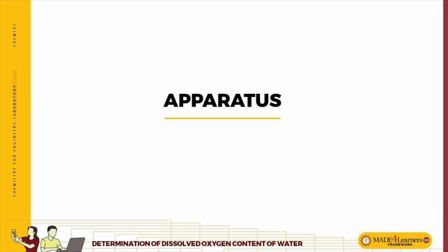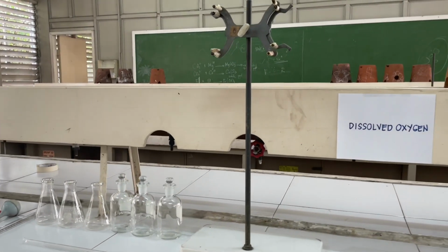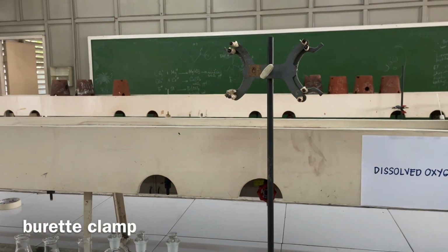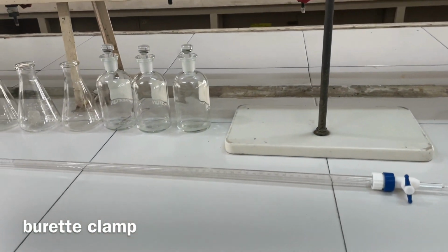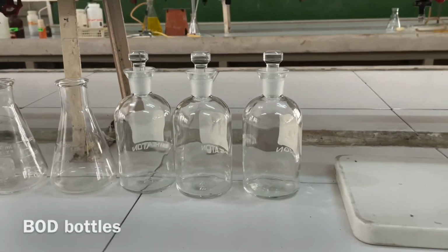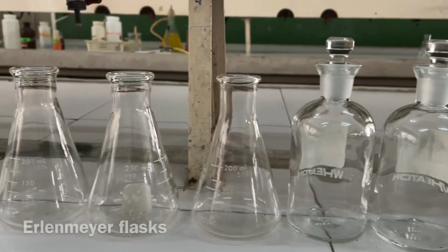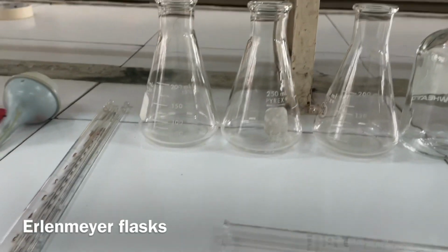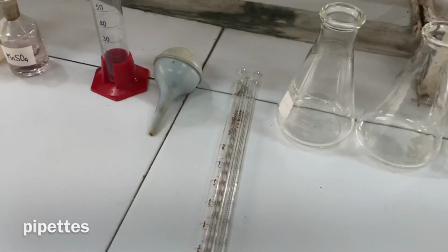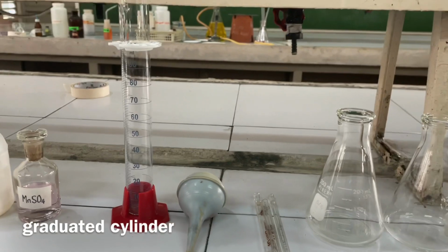The apparatus needed in this experiment are iron stand, burette clamp, acid burette, BOD bottles, Erlenmeyer flasks, pipettes of different sizes, pipettor, and graduated cylinder.